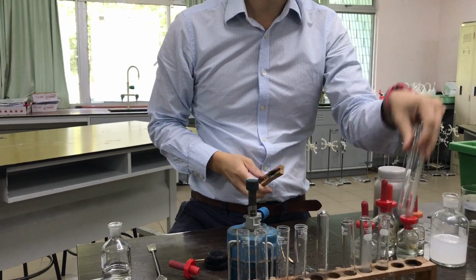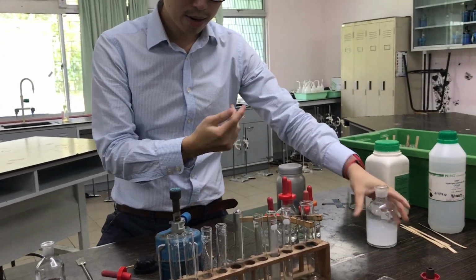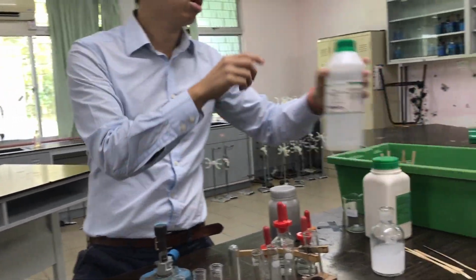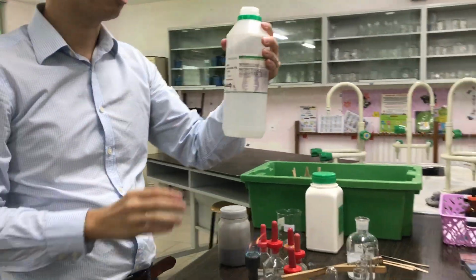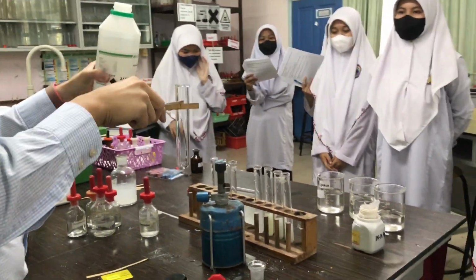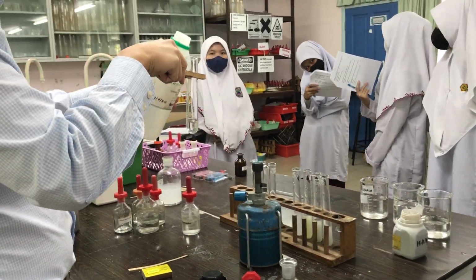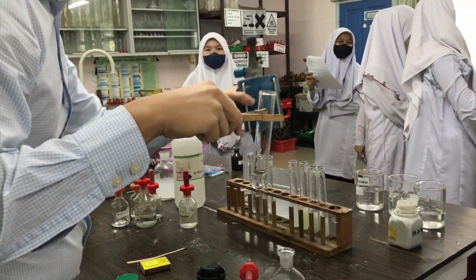Now you're gonna test for oxygen, okay? Someone gonna try test for oxygen? Okay, Shafika, come. Alright? Now, Shafika is going to produce oxygen. This is hydrogen peroxide. You can get it, careful with the fire, yeah? You can get it from Guardian or anywhere also. See, we don't need the fire.